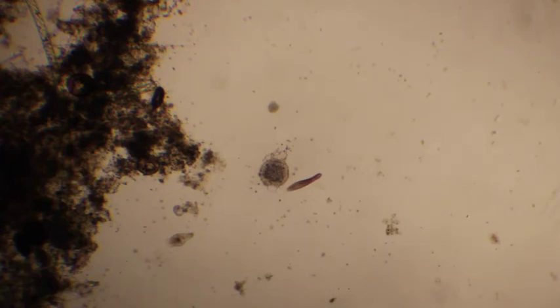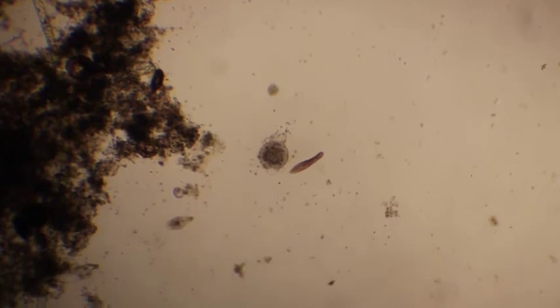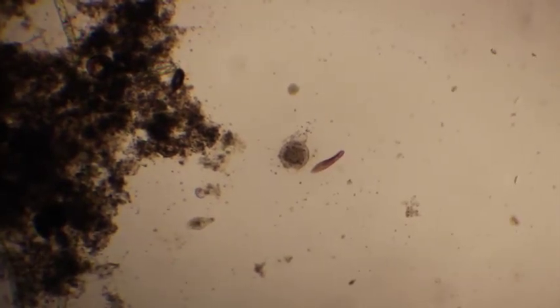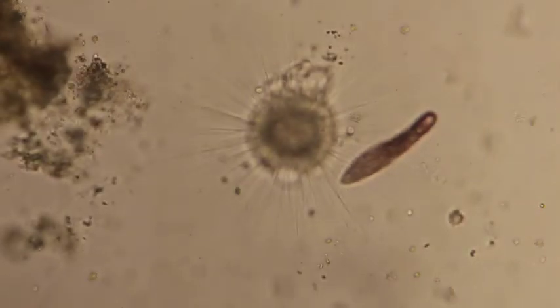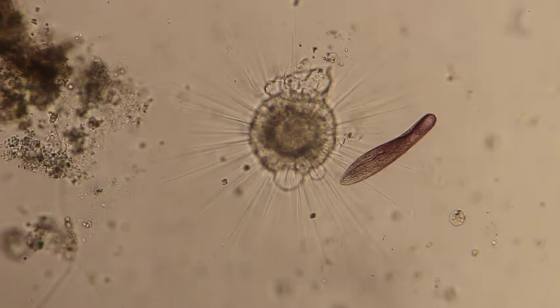Okay, here's another guy. This guy's kind of interesting. It's an amoeba-like organism called an Actinosphaerium. The Actinosphaerium there is in dead center. It's right next to a ciliate, which is a Blepharisma. The interesting thing about an Actinosphaerium is that it is a predator, like other amoebas. It has these long, spiky structures sticking out, which are its pseudopodia.